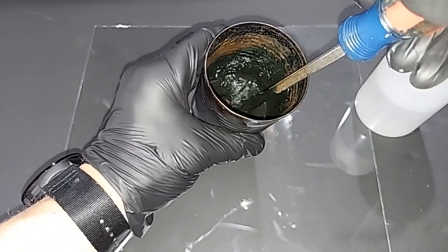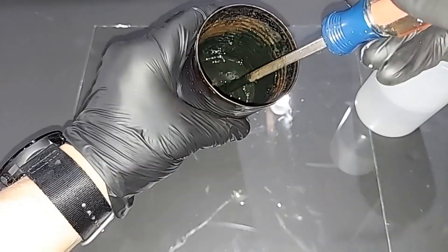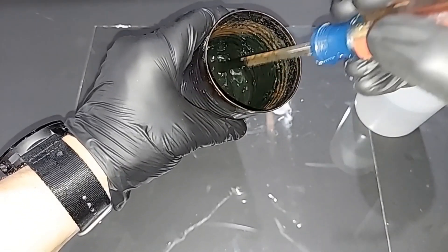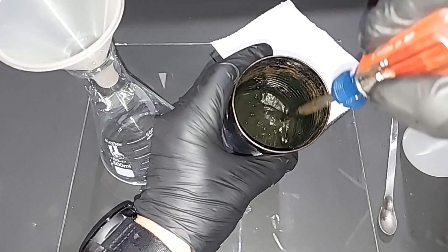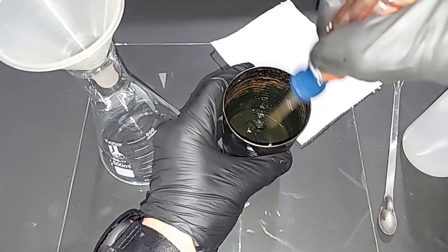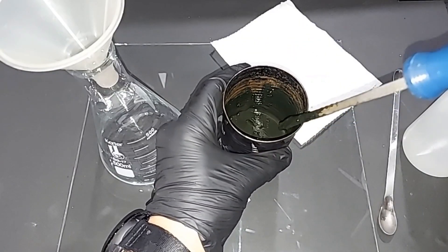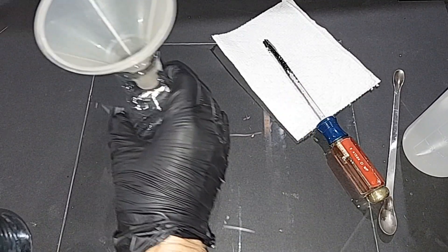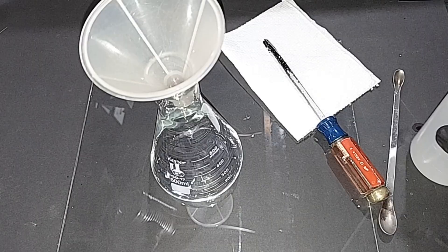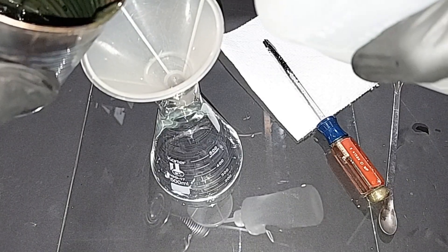This has to be poured into a flask next, so I'll have to add enough water for it to be able to get out of here. All of the big chunks have been pretty much smashed, so it's all this mushy slurry stuff right now. I don't need a screwdriver anymore. The next step is to get it in here, so I'm going to add some water.